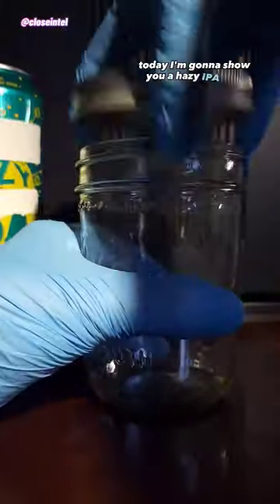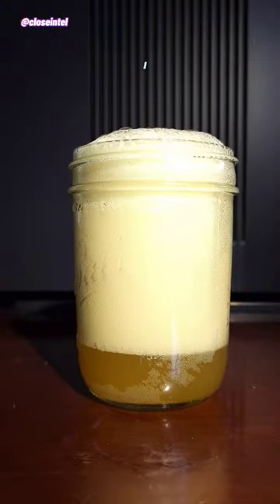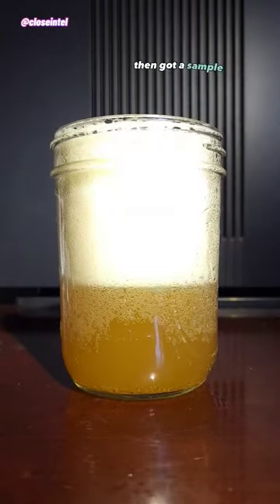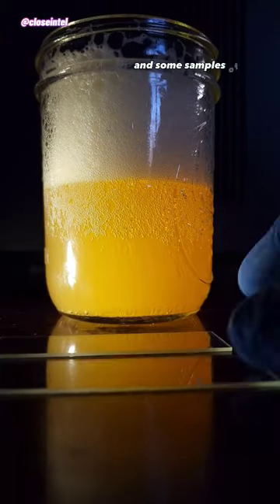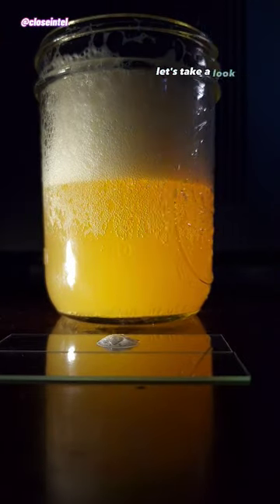Today I'm going to show you a hazy IPA beer under the microscope. I poured some into a glass jar, then got a sample of the foam at the top and some samples of the liquid at the bottom. Let's take a look.